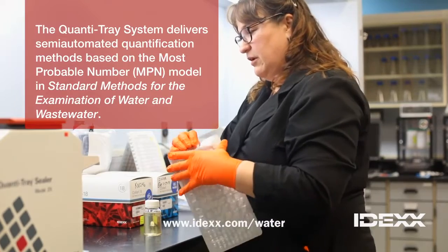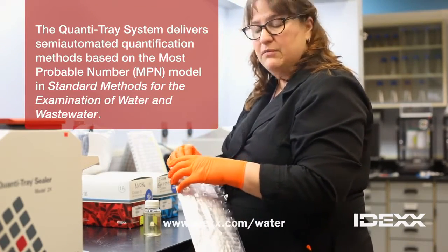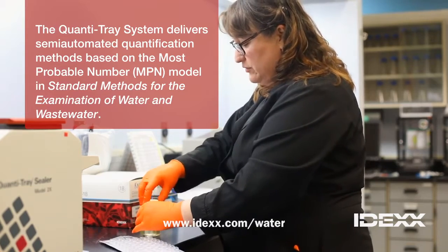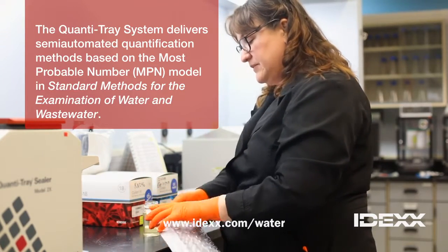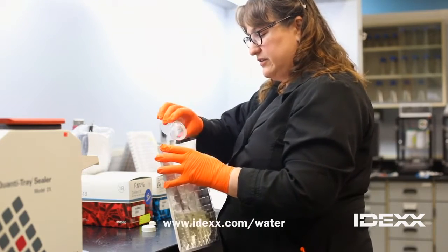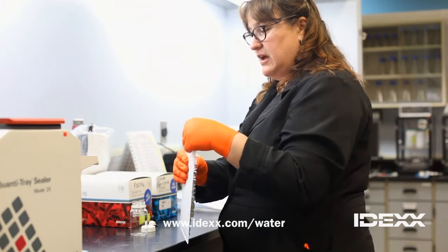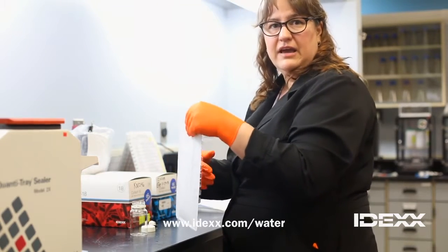It's a way to enumerate or count how many fecal coliforms are in the water. And this is a little bit more of an advanced method. Not everybody's using it, but it's much faster than the old way of membrane filtration. And we really enjoy the accuracy of it and the way that the samples between analysts can be counted.